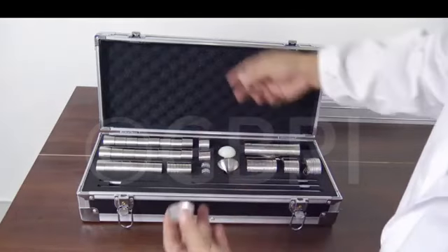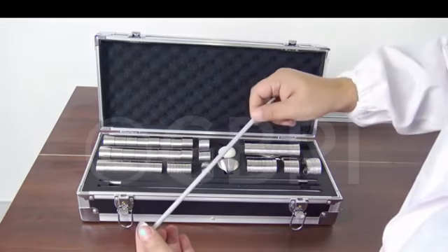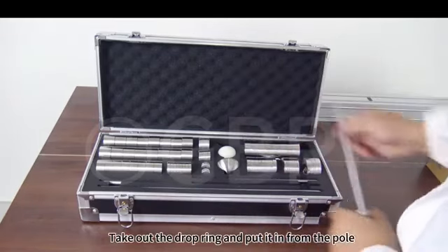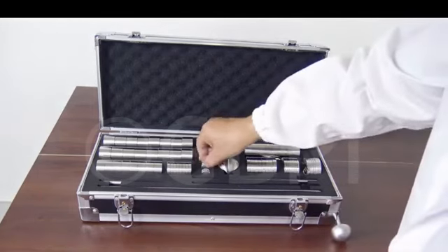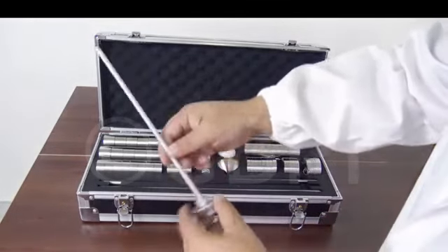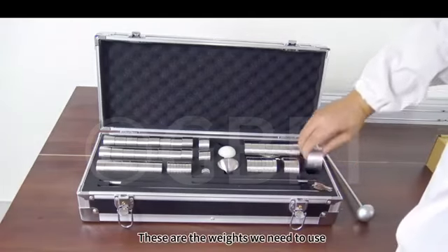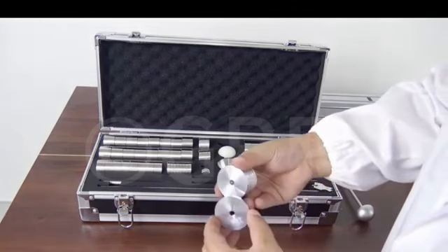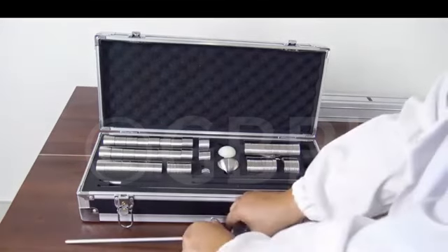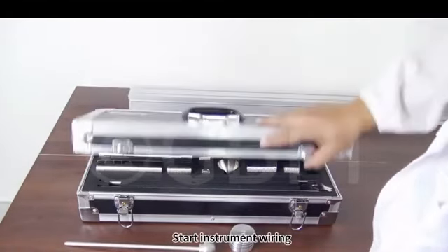If we use method A, take out the corresponding aluminum bar according to the requirements. Take out the drop ring and put it in from the pole. These are the weights we need to use. When ready, start instrument wiring.